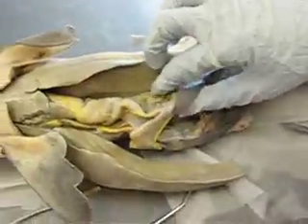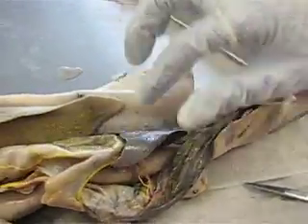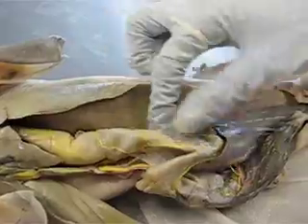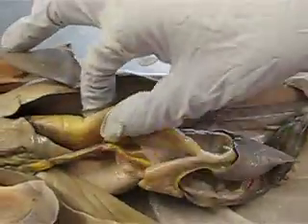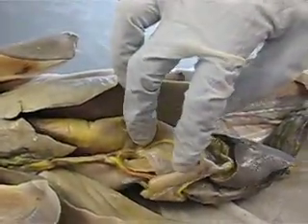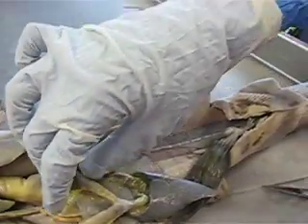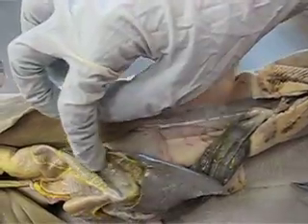Here's the spleen. We have our stomach. The lesser curvature is going to be in here, and the greater curvature is going to be in here.